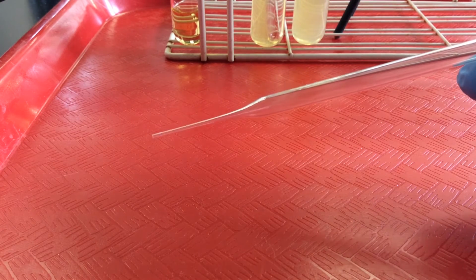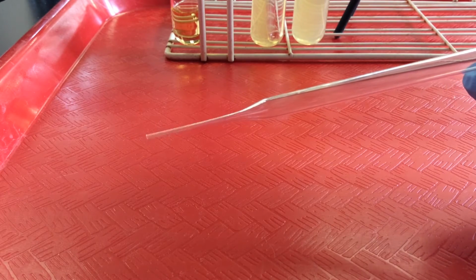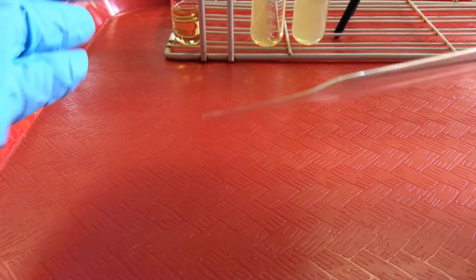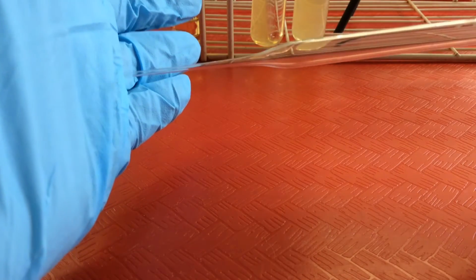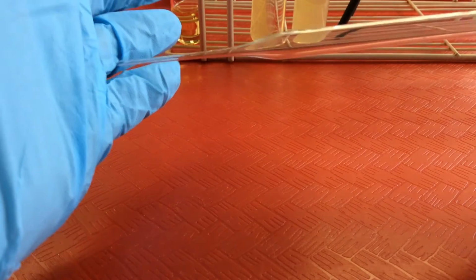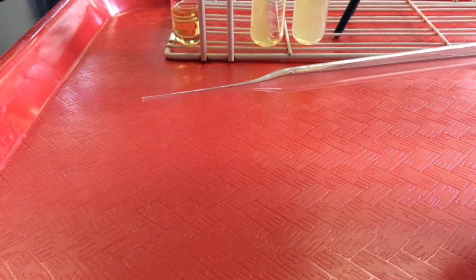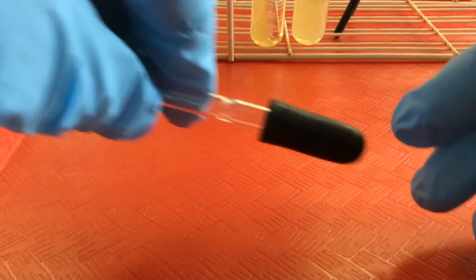What we want to remember is that when we're finished with our Pasteur pipettes, they never go into the regular trash. They can actually cause a lot of damage if people come along and are helping us clean up. The Pasteur pipettes can act as almost like a needle and jam right into the hand. So glass, including Pasteur pipettes, always go into the sharps or broken glass containers. We want to remember always to remove the rubber bulb, right? Because these we don't want to throw away.